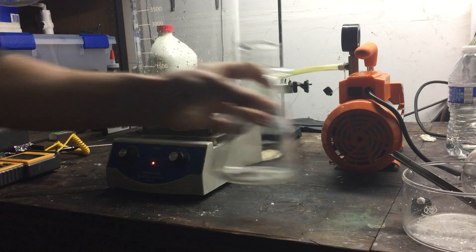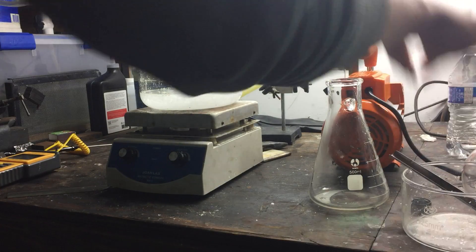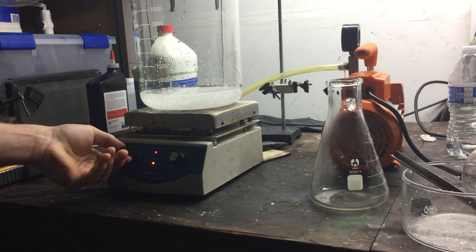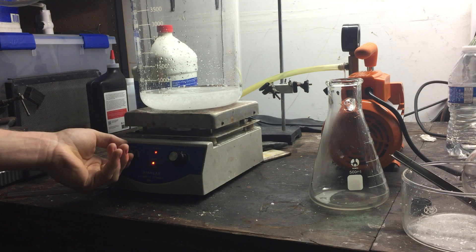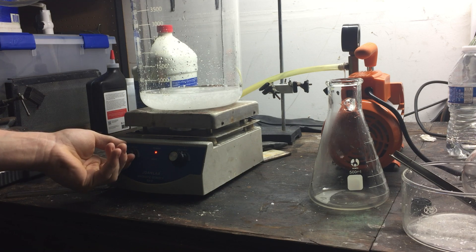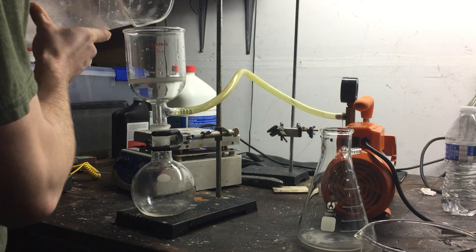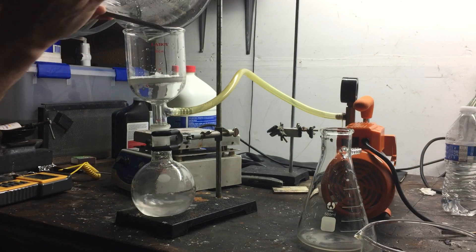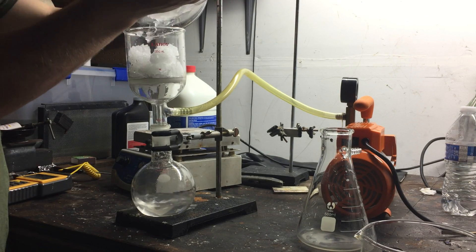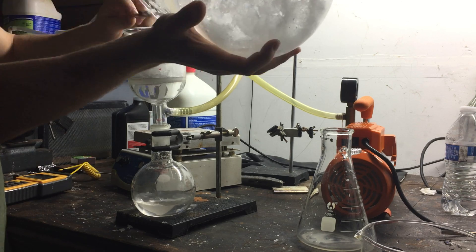Now, obviously, all of these crystals aren't going to dissolve at this temperature, so we'll have to bring the solution to nearly boiling. You can see here that everything dissolved pretty nicely. The solution was then placed back in the freezer, where everything crystallized out for one last time.